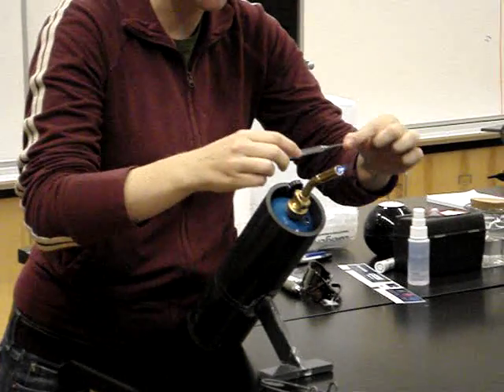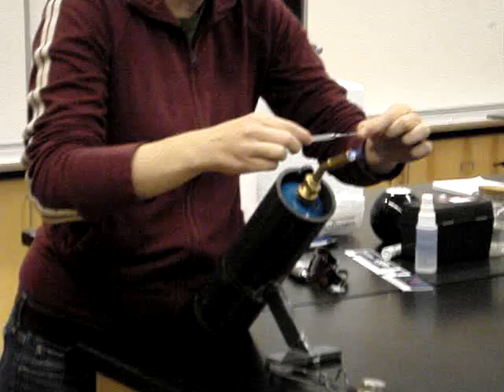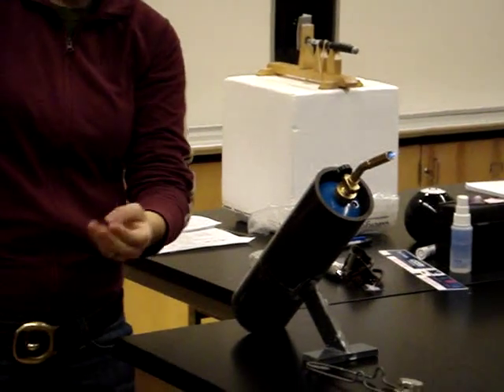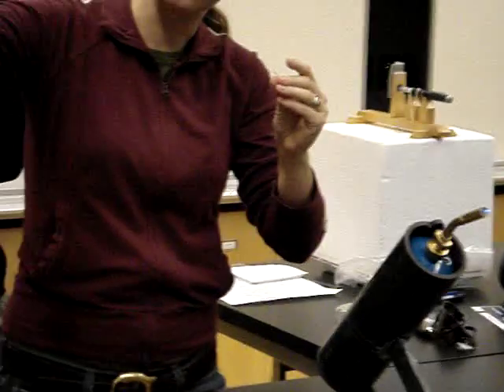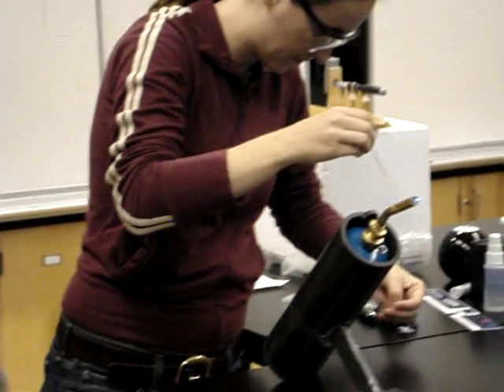Just kind of hold it right into the flame. And see it start to get a little bit kind of wiggly. Pull it out. So it's really fast. That may or may not be sort of a great thickness, but it looks okay to me. That's a very small one — it's going to be a high magnification.